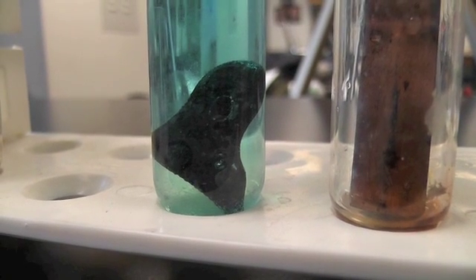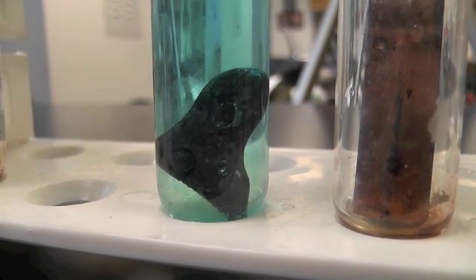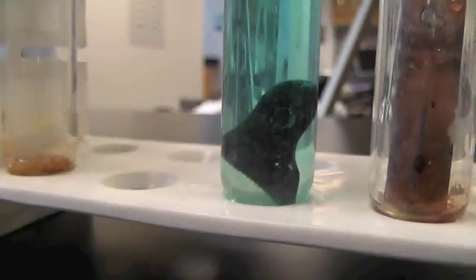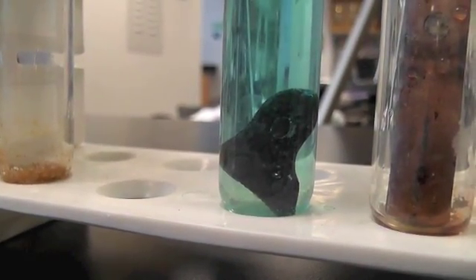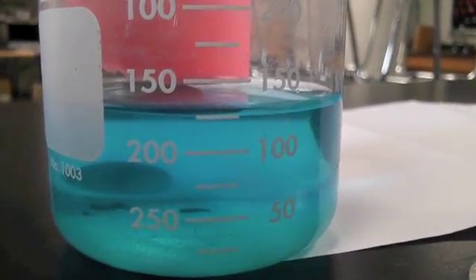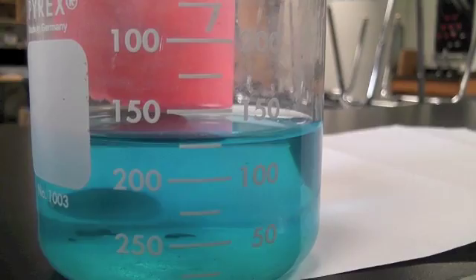Okay, so here we are with the lead in the copper nitrate. And you can see at the bottom, some of the color is starting to go away. So it started like this color. Here's the copper nitrate with nothing reacted in it. And if you take a look at the test tube towards the bottom, the color is starting to fade.